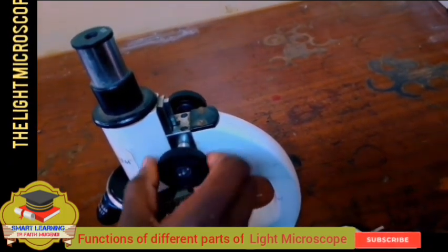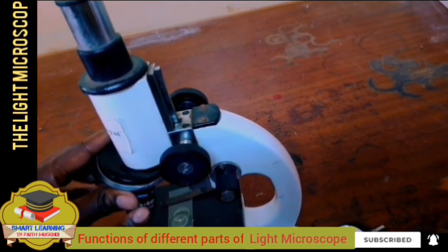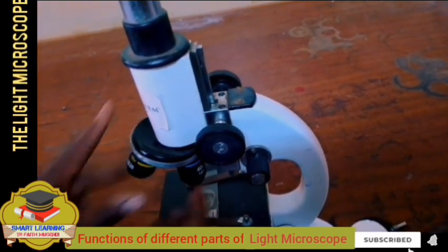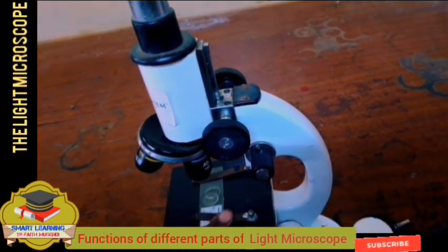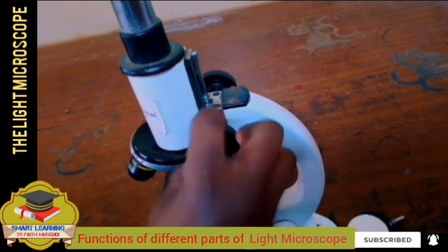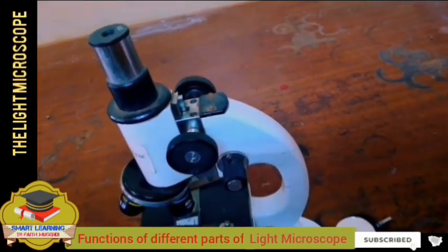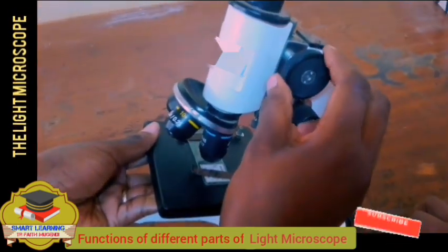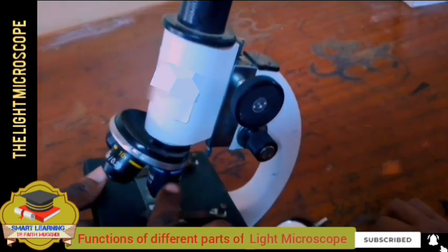And again, if you use this one with the high objective lens, it can easily crash the specimen or the microscope slide. Look at that. So that's why you are told care must be taken when you are using the high objective lens.